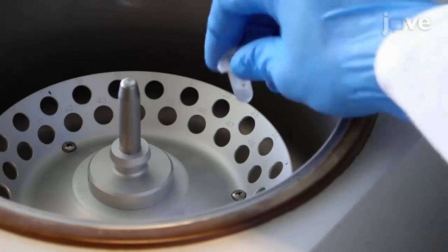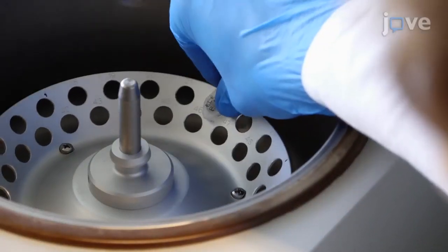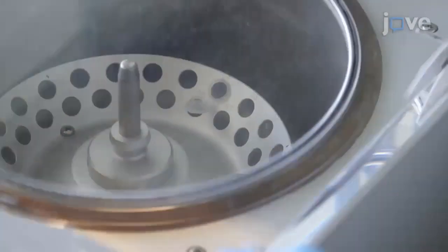To begin this procedure use a centrifugal vacuum concentrator to concentrate the ELP solution to 1.1 millimolar.